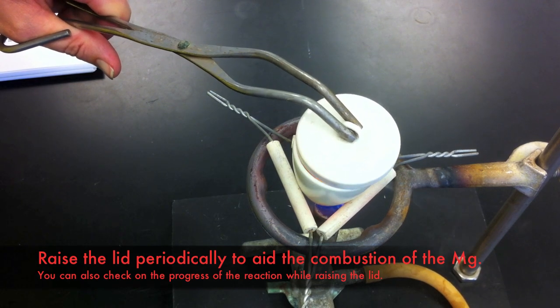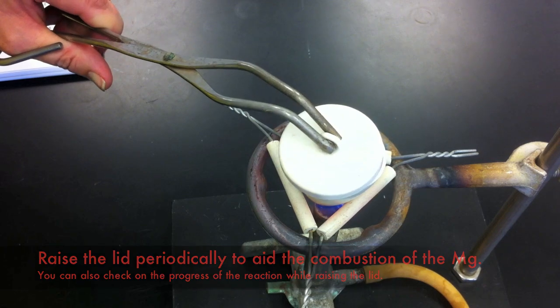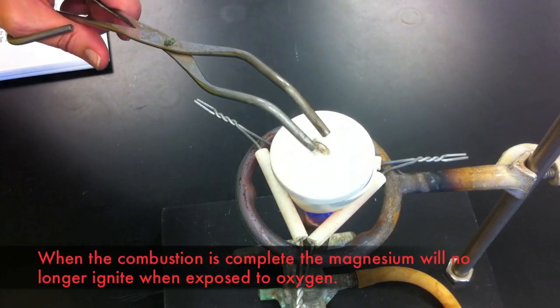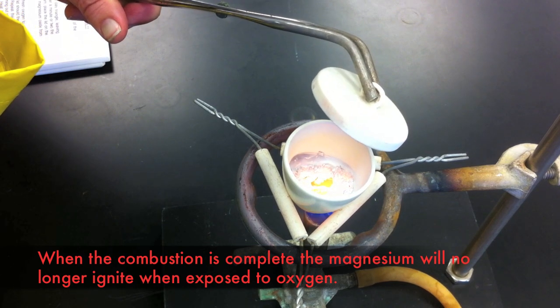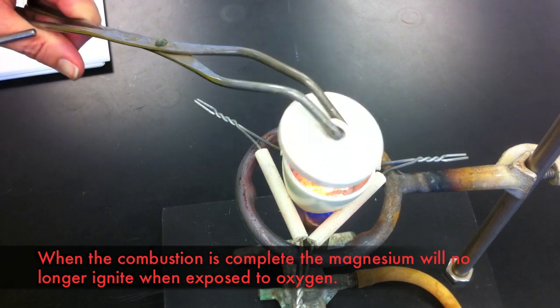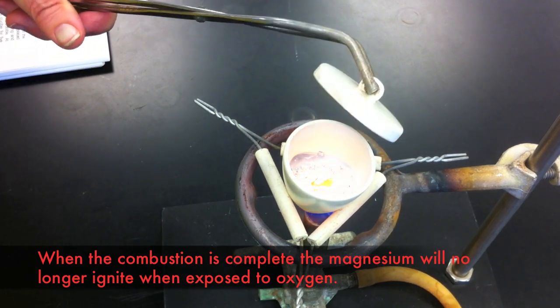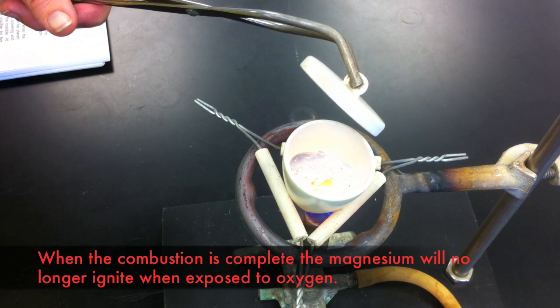Allow the reaction to proceed, periodically checking on it to see whether or not ignition occurs when the lid is raised. When ignition finally ceases, you know that the reaction is done. At the moment, you can see this is still glowing hot, but no ignition is taking place, so we know that the reaction is done.